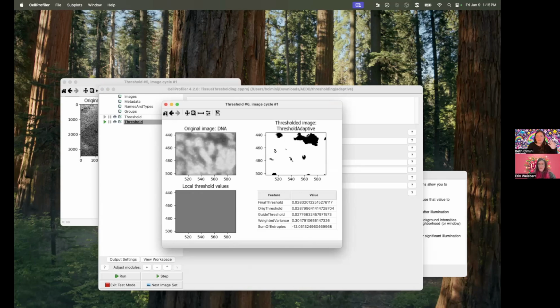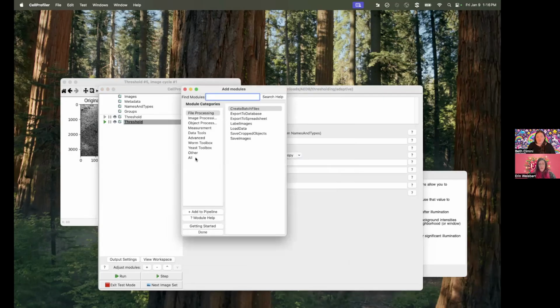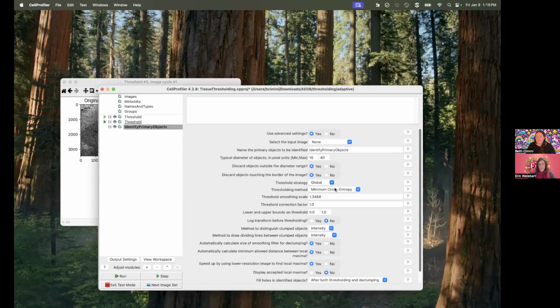But I think to answer Susan's overall original question, this is a super common thing. The solution to it is adaptive thresholding. In the Identify Primary Objects module, if you turn advanced settings on, when you go to do the thresholding, you have the same global or adaptive. And so assuming you don't decide to just go do something like Cellpose, which you possibly should, switching your Identify Primary Objects from global to adaptive will get you what you want. Love it. So simple, just one button change. But you have to know which of the thousand buttons, which is why I'm so glad Susan wrote in, because we could tell her. Yes, absolutely.